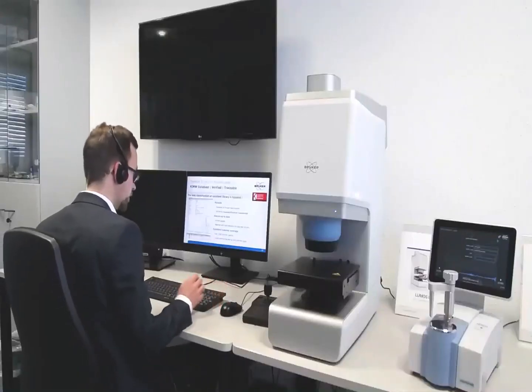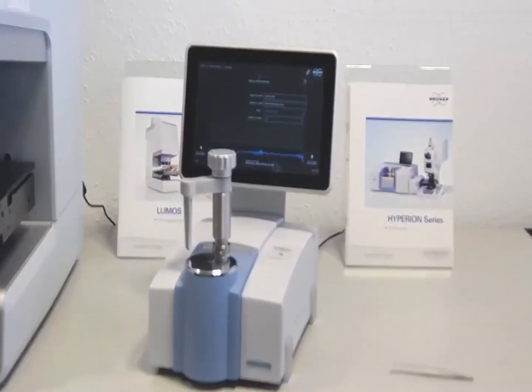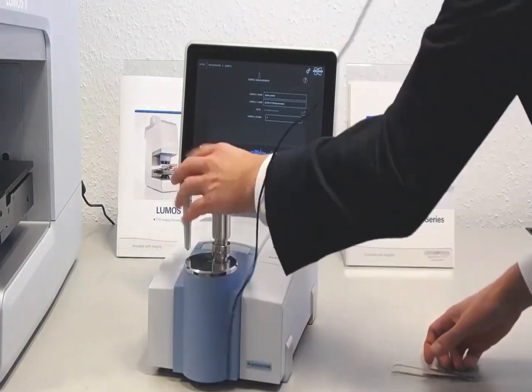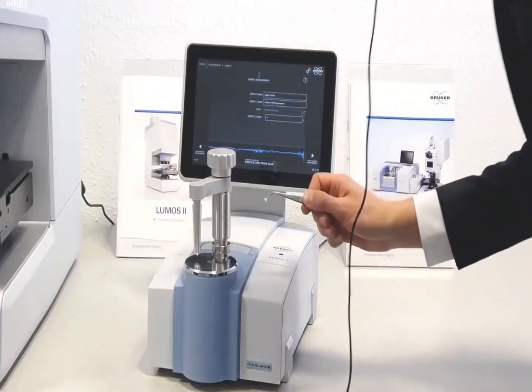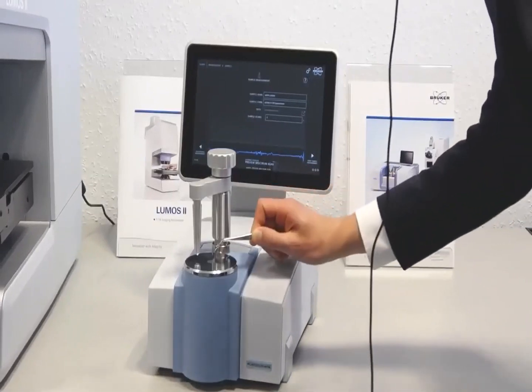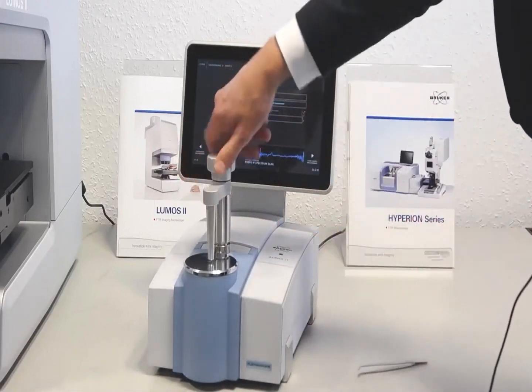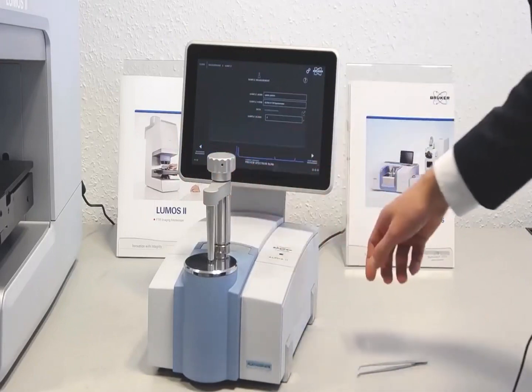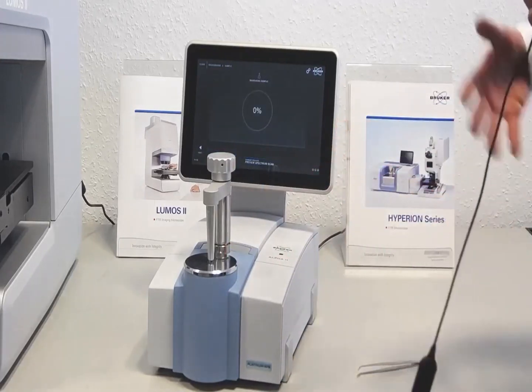But it's always best to demonstrate this using a live example. So this is again our Alpha 2 compact FTIR spectrometer. This is one of the many exchangeable accessories, in this case a high pressure ATR with a rotatable clamping arm. And this one here is a piece of plastic just about 5 millimeters in size. And I will just place it on the ATR crystal, close the arm, and you will already see a preview spectrum here. So you know it's in good contact, and when you tap the Start Sample Measurement button, it will automatically run the measurement.